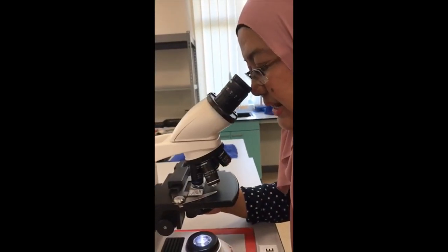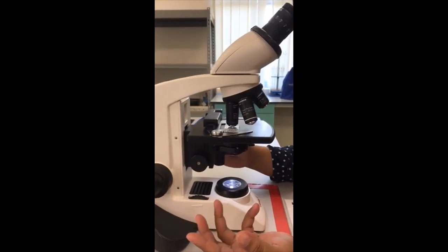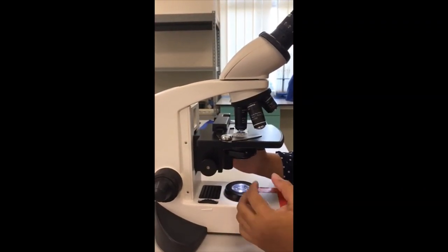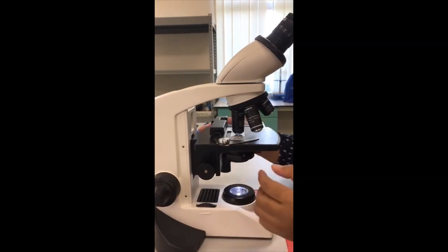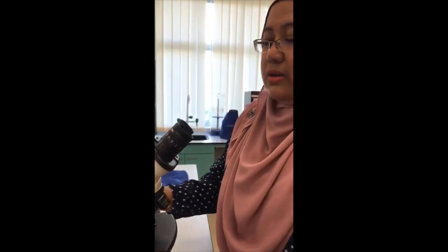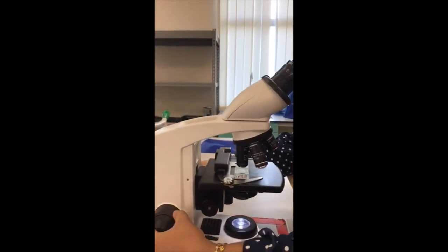After I observe my slide, draw, and identify the stage of mitosis, I need to remove the sample and switch off the light microscope. I need to make sure that the stage is lowered.